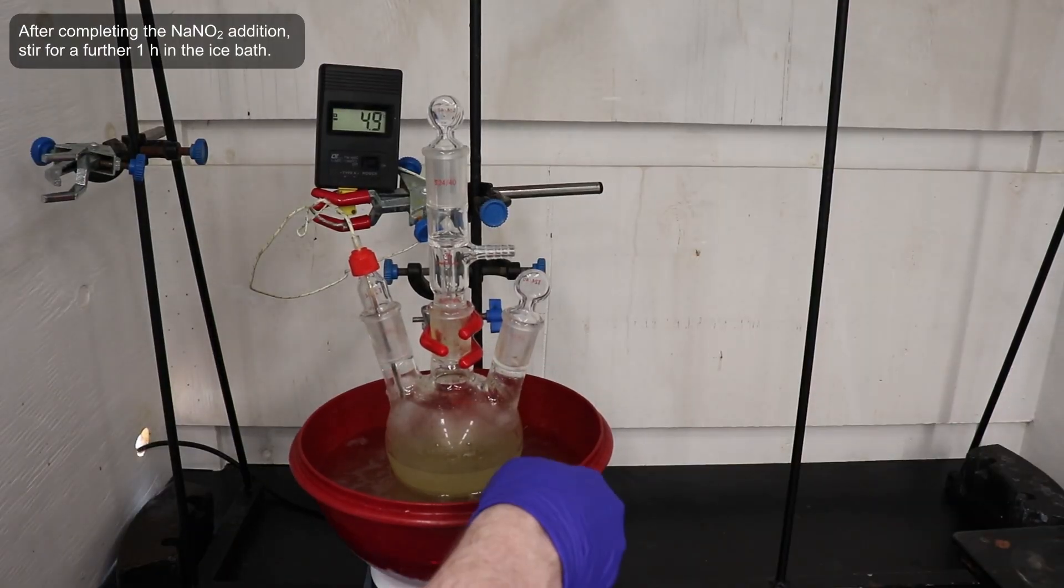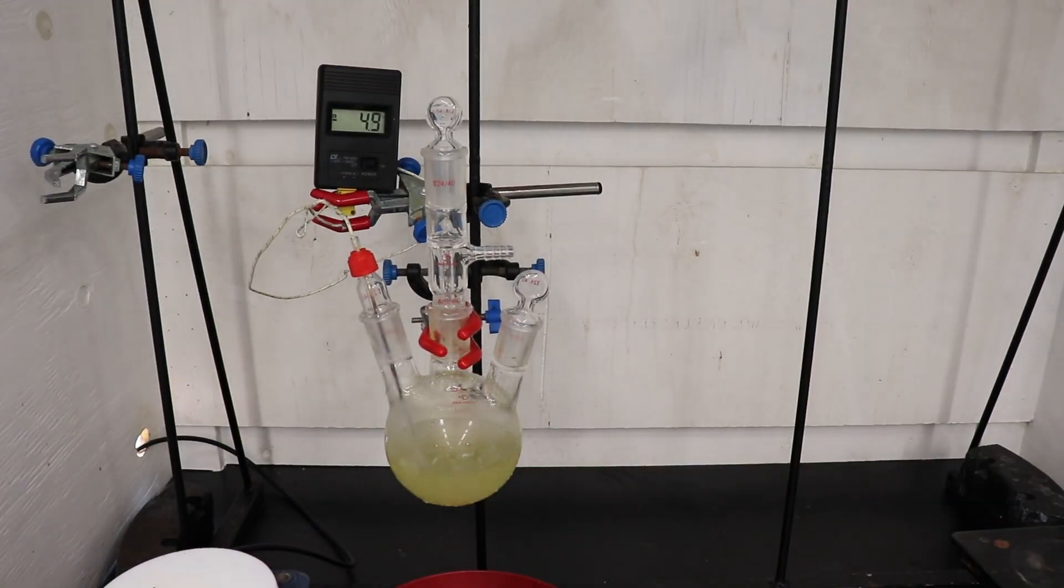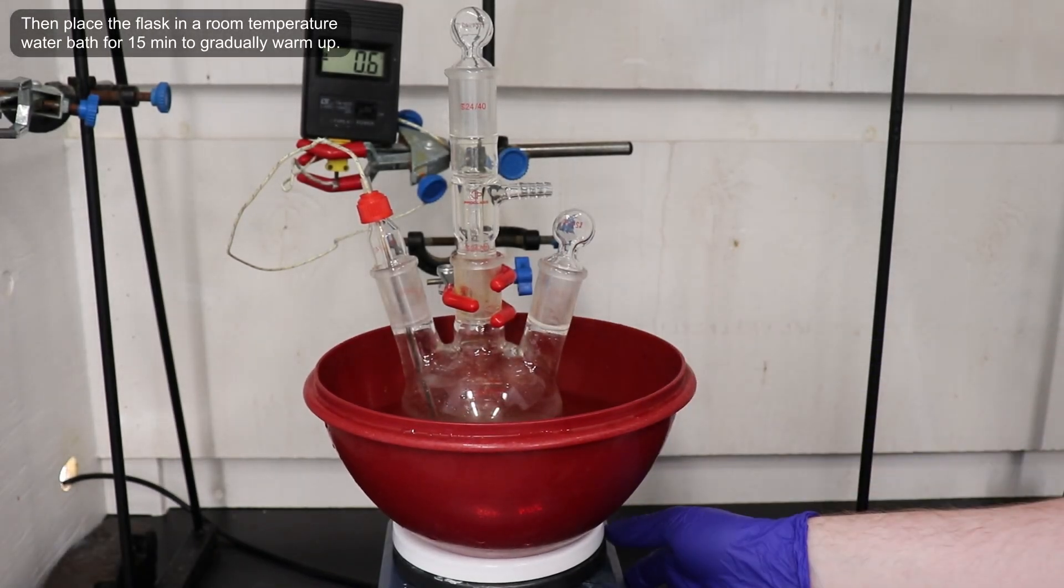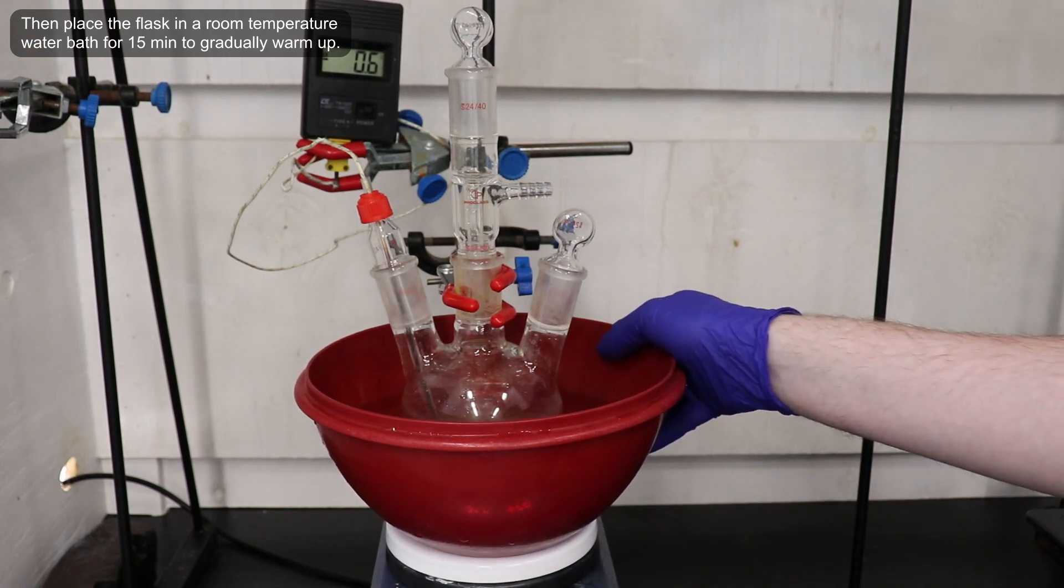After the hour-long wait, the solution was still at around negative 5 degrees Celsius, and the next step is to swap out the ice bath for a room-temperature water bath, where it was allowed to stand and warm up for 15 minutes.